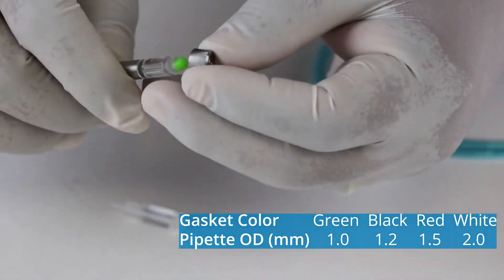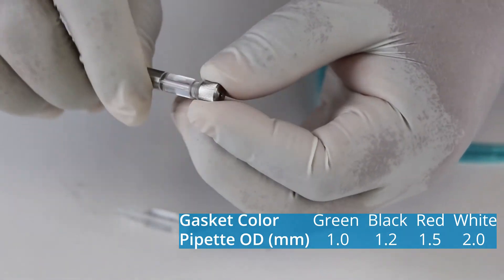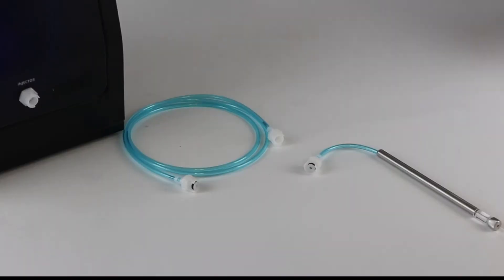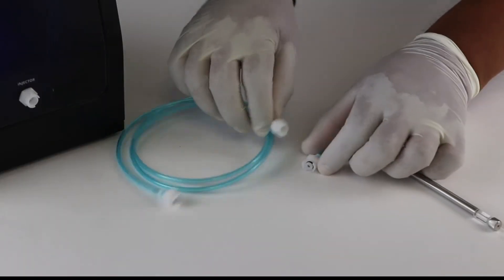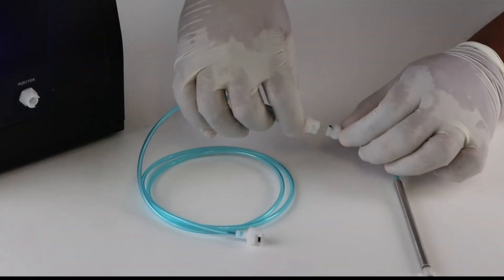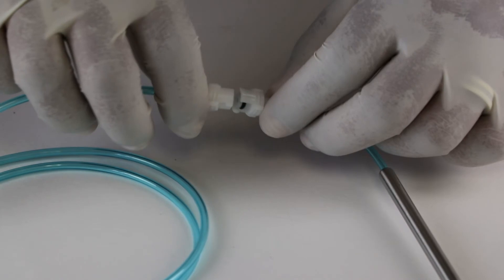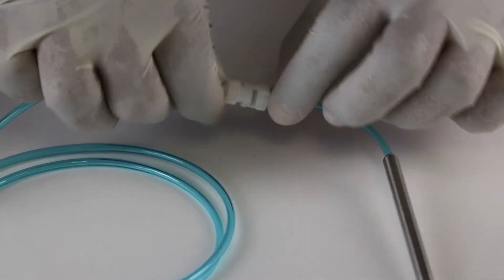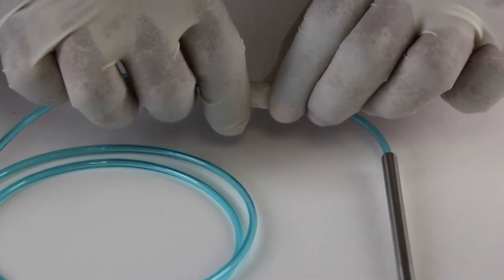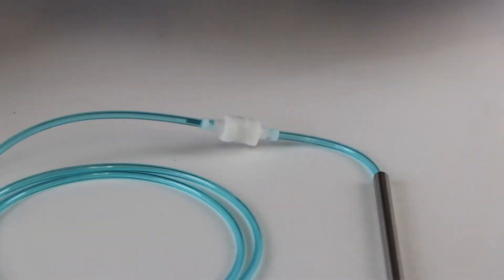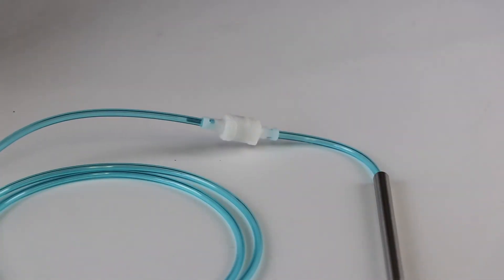Place the gasket of the correct size in the cap. The other end of the small tubing has a quick connector. Connect it to the blue PV850 tubing assembly provided.